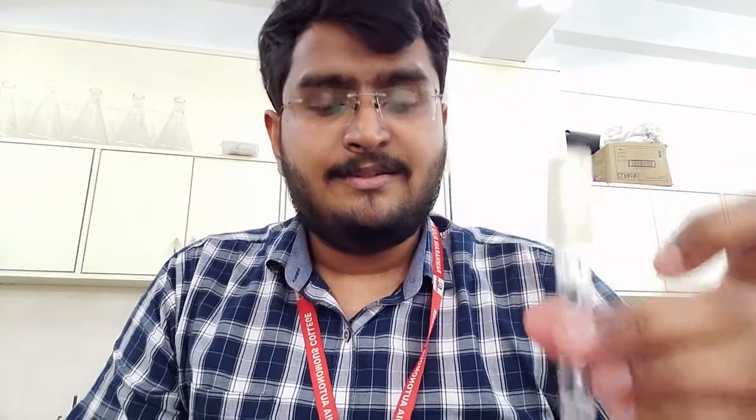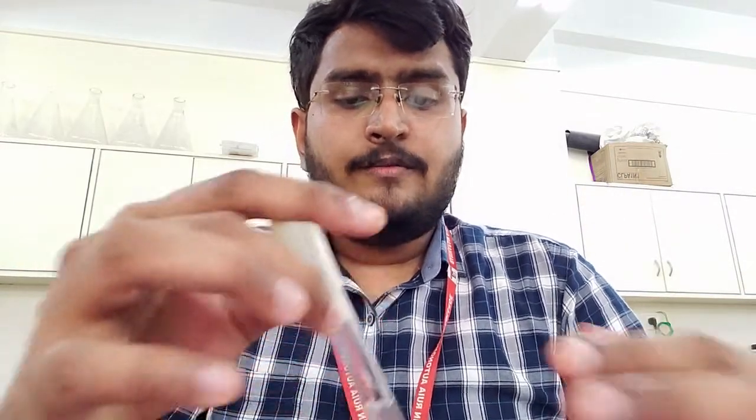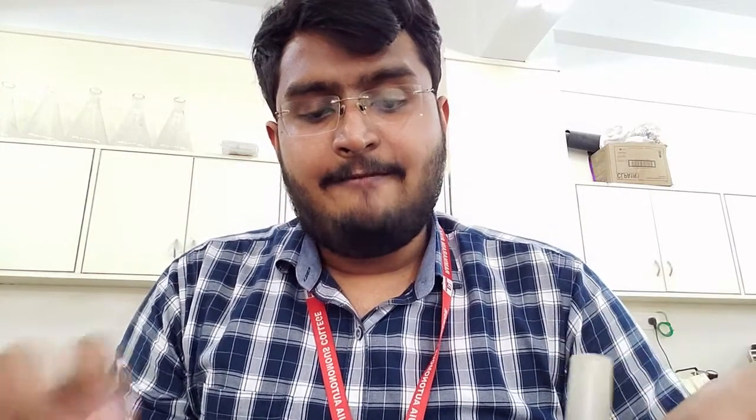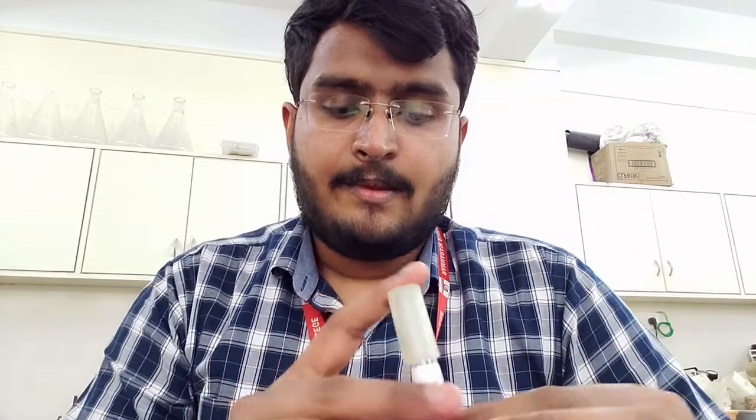I have prepared four culture suspensions: Streptococcus pyogenes, an unidentified alpha-hemolytic strain known to show alpha hemolysis, E. coli, and S. aureus. I will be inoculating all of these on blood agar plates as well as into the RBC suspension, and we will observe the results.